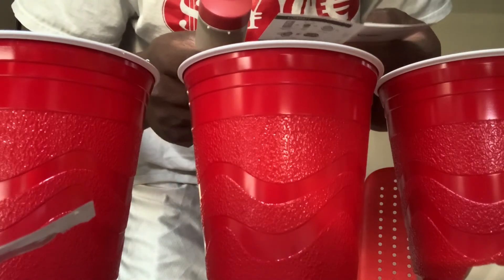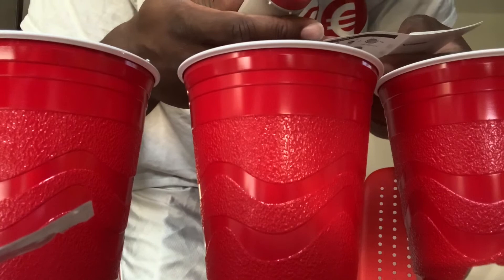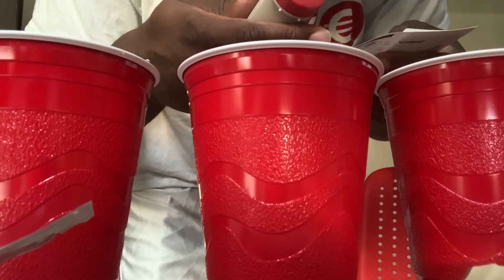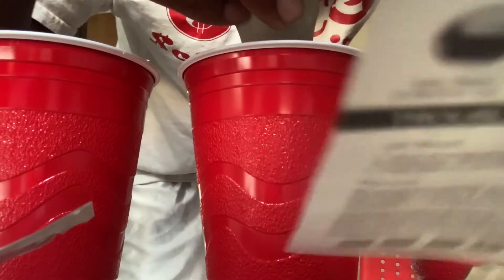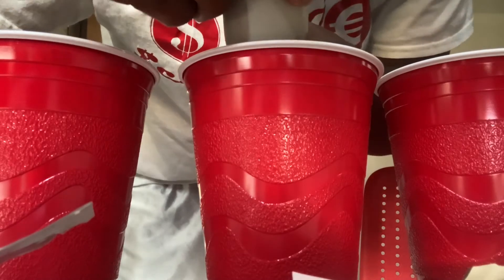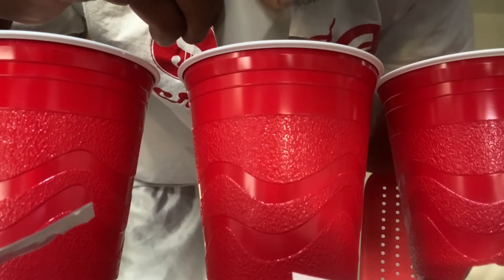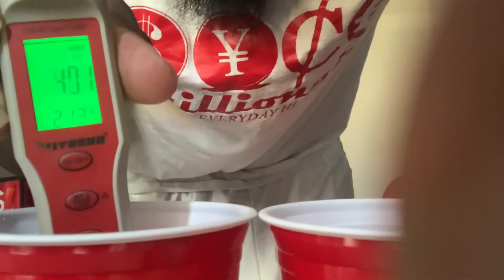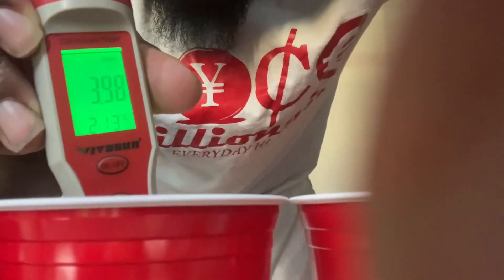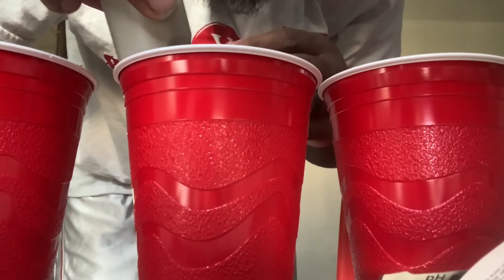So the next up is the 4.0. We'll do the same thing — turn it on, put the electrode in the water, hold the calibration button for 6 seconds: 1, 2, 3, 4, 5, 6 — calibrate it. 4.0 you guys. Let's move it around because I'm shaking, but 4.0. Turn it off.